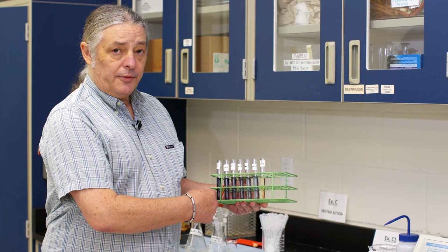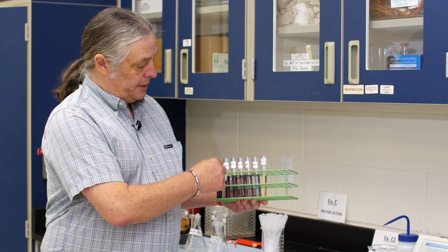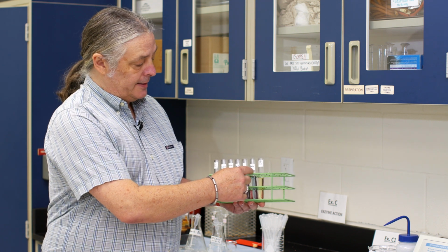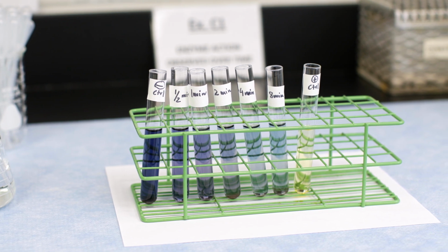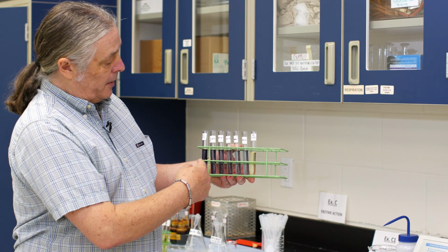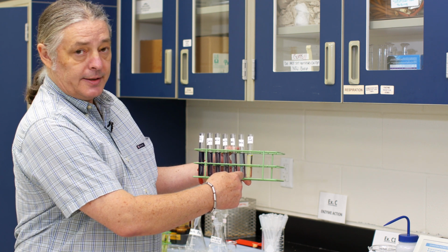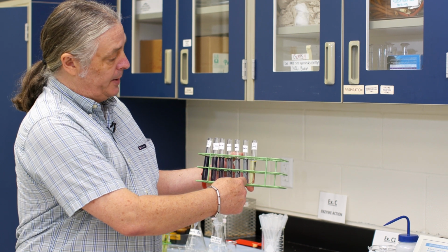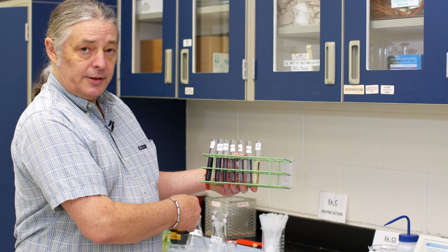Okay, so we've gone through the time steps, adding the starch and amylase solution to each of the test tubes that we set up ahead of time at the different time increments. And as you can see, we've got a little bit lighter color of that reaction of starch and iodine indicator from the very earliest time step toward the latest time step, as the starch has had more and more time to do its thing in that beaker that we set up at the beginning. And of course, we have controls at either end to compare these results to.